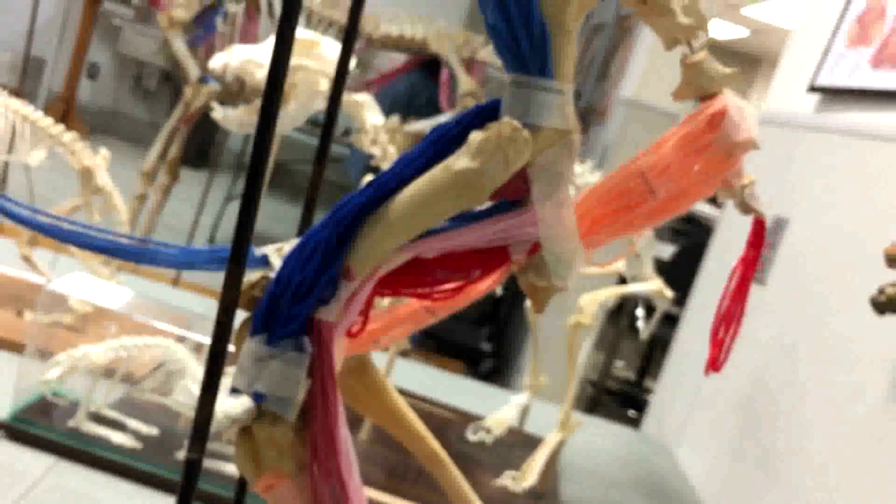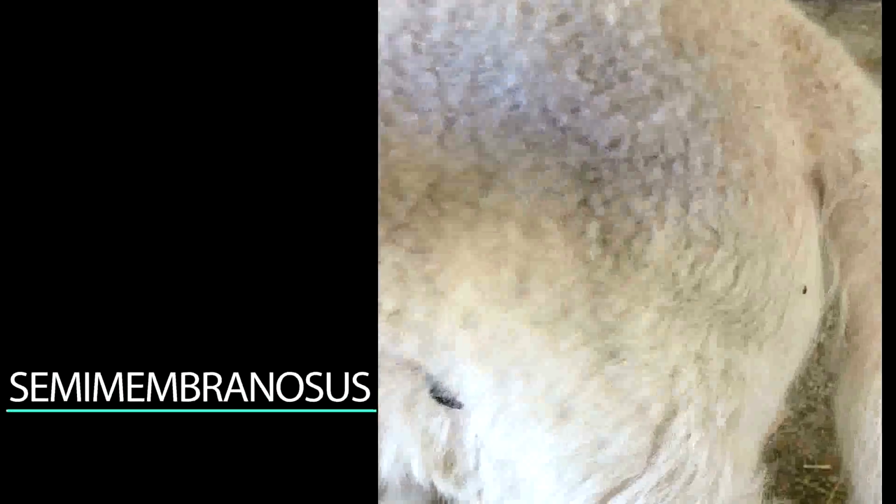The semimembranosus muscle is attached to the pelvis and tibia on the rear limbs via tendons. Its functions include the flexing and rotation of the leg, along with serving as a thigh extensor.